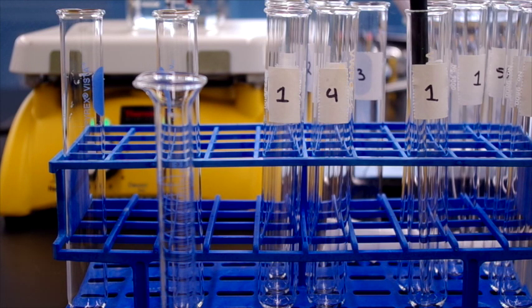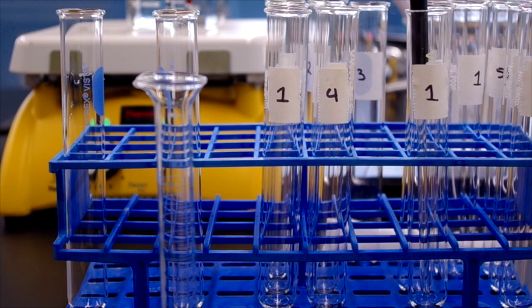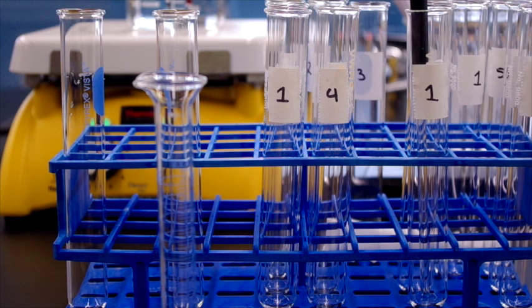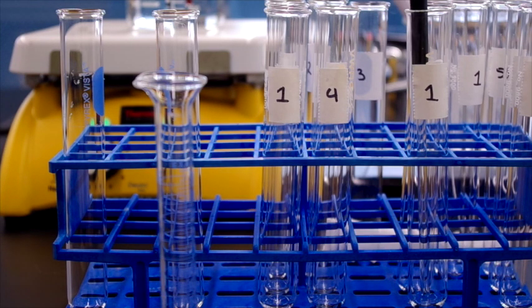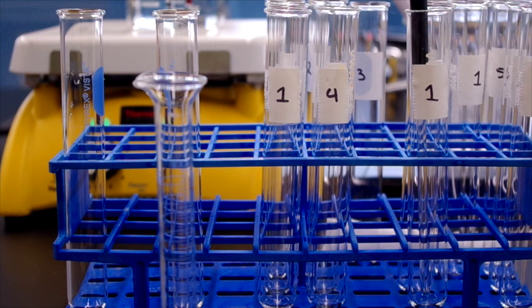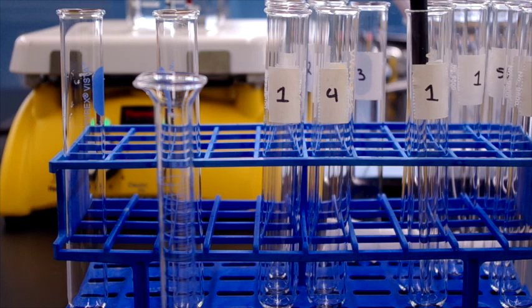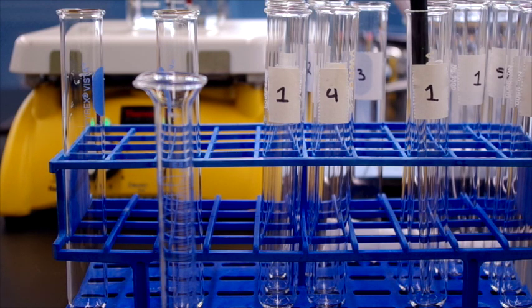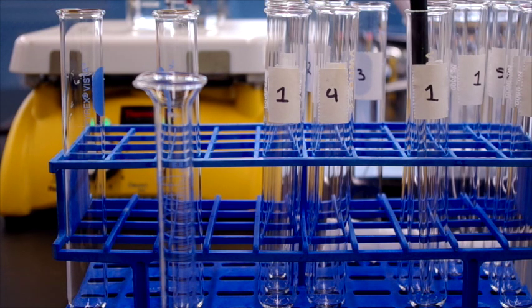Part A1 is testing the effect of temperature on the rate of a reaction. We're going to start out with our two test tubes. In the back you can see two beakers — one is set up as a warm bath and the other as a cold bath. We're going to place 10 milliliters of 0.1 molar hydrochloric acid solution into each of them.